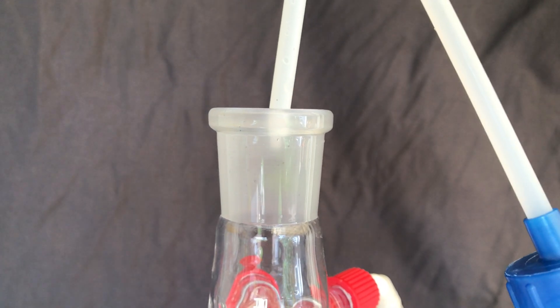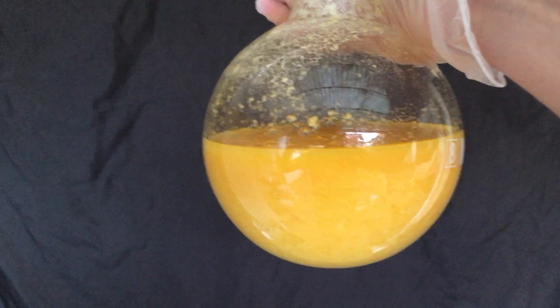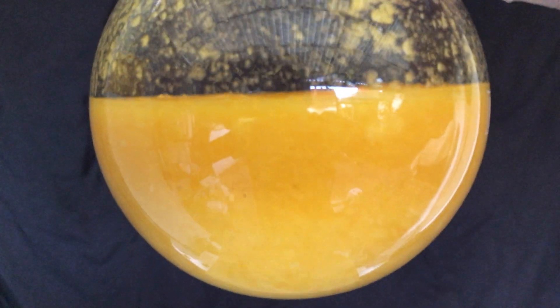45 minutes have now passed. I am now going to add a lot of distilled water. While continuing to reflux I added just enough distilled water to keep the solution clear. When more water is present the solubility of benzoin will vastly decrease. You don't really need to add water — I added it to increase the yield at the expense of purity, but I am going to perform a recrystallization anyway so that doesn't matter.